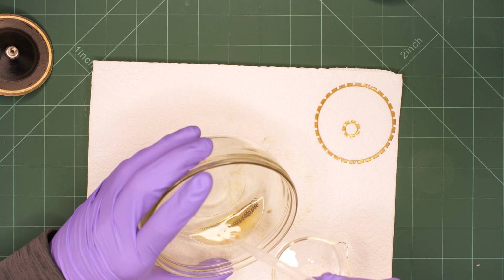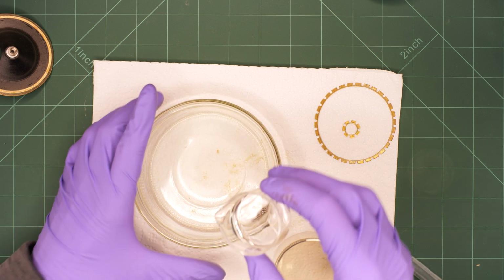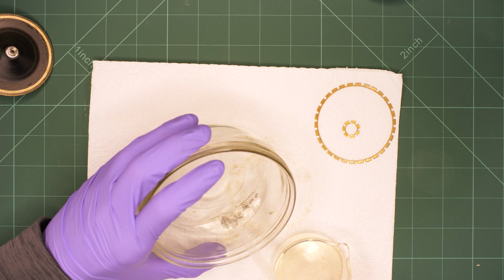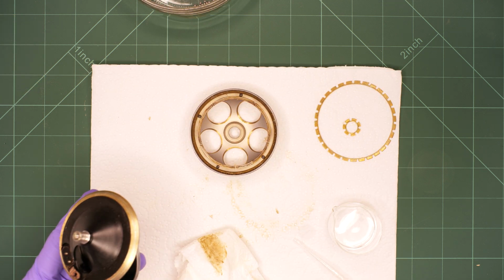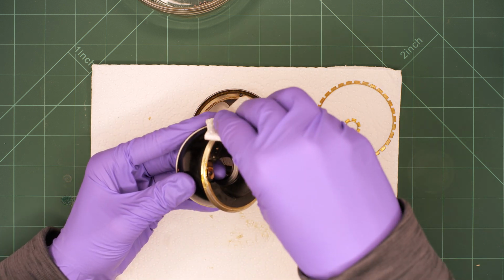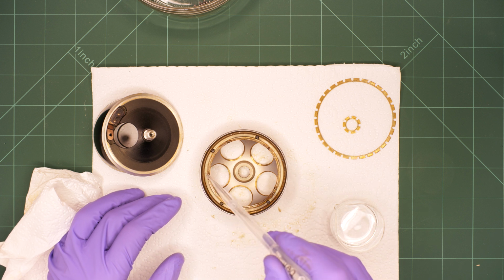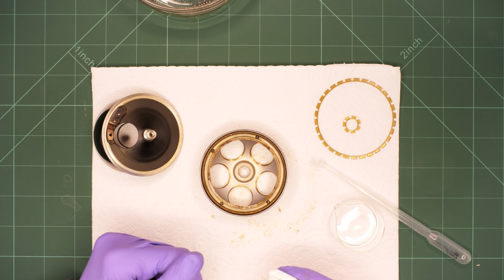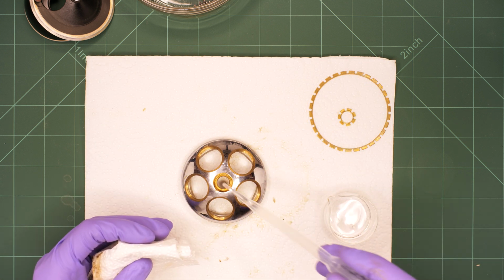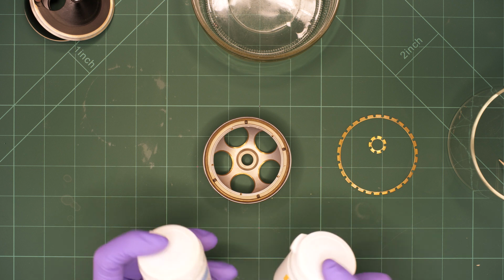I removed the old solvent with a pipette and washed the ball bearings with some fresh solvent. I swirl the ball bearings using the pipette to remove any remaining grease that is stuck. Both halves of the nosepiece will now also be cleaned with some paper towel and solvent. The place of the small ball bearing is cleaned as well. Everything is cleaned. Now it's time for relubrication.